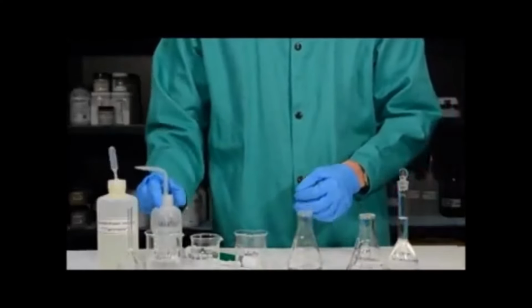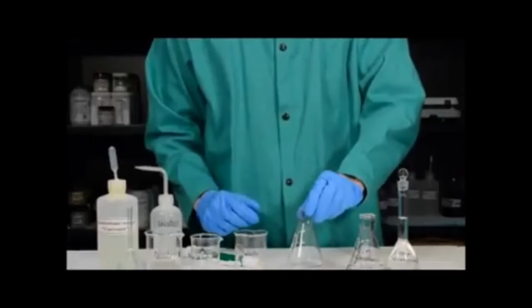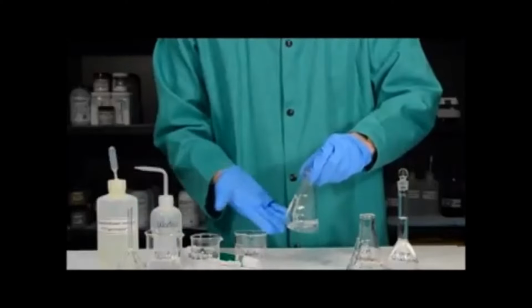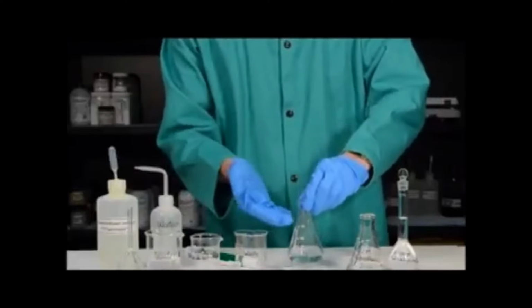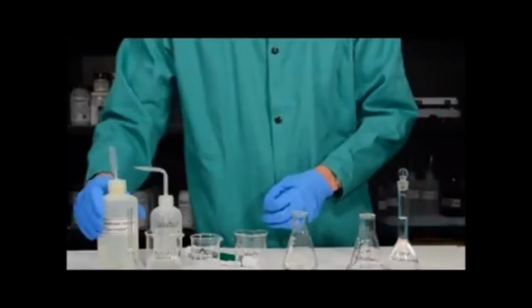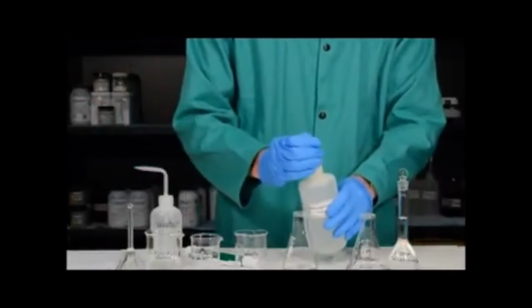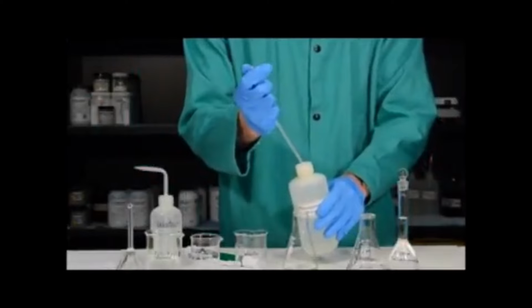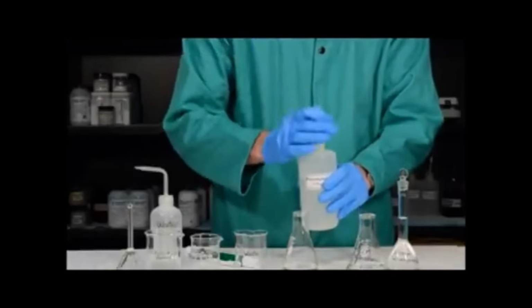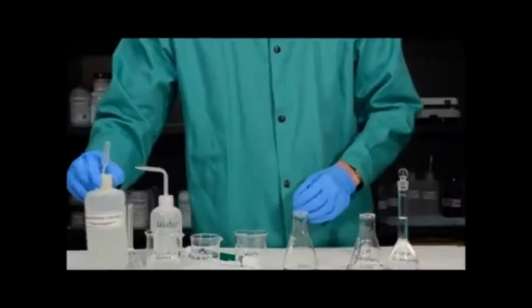And in a titration, I'm going to react the sodium hydroxide and the hydrochloric acid. Since the water doesn't have any hydrochloric acid in it, I can use a reasonable amount. This is not to say you should fill the entire flask, but a reasonable amount of water is fine for your rinsing. Finally, I want to add a couple drops of phenolphthalein indicator. With many things in life, more is better, but phenolphthalein is not one of those things. 1 or 2 drops is plenty.